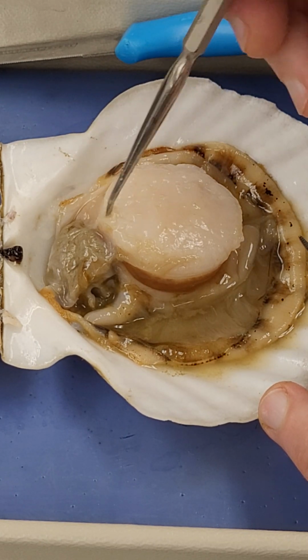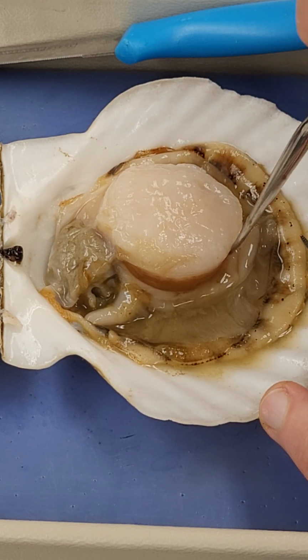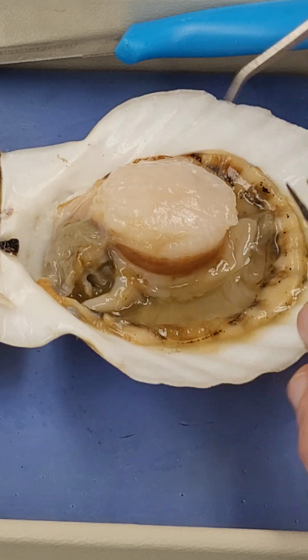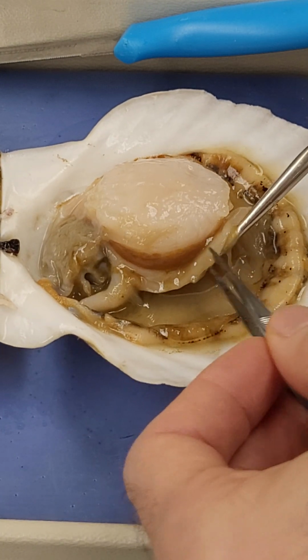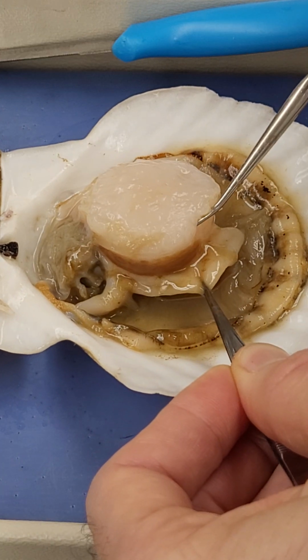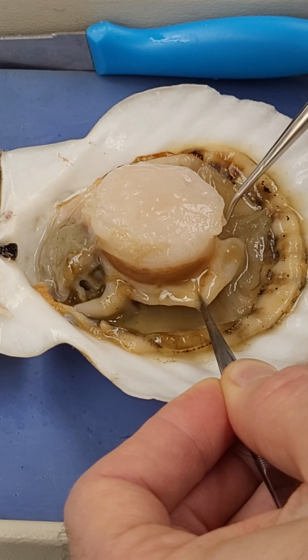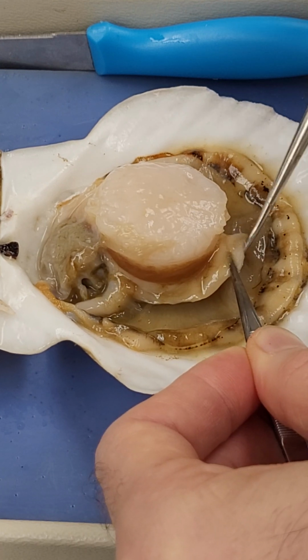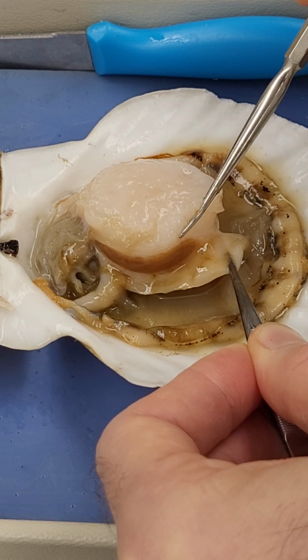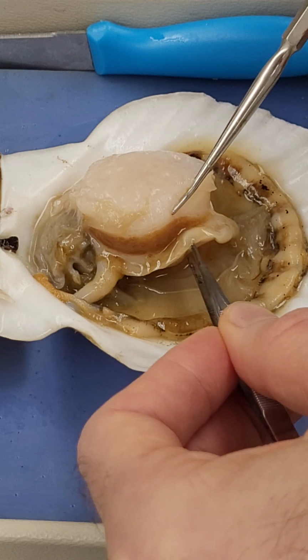Let's think about some other structures. We have a kidney just here. That's going to be processing all of our blood. We have here the foot. And actually, typically, you'd also have the roe located here. I think this one's a male because it has a white region just here. That's our hypothesis for this individual.